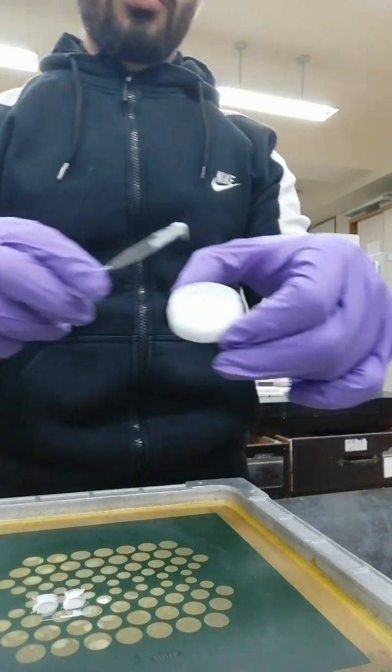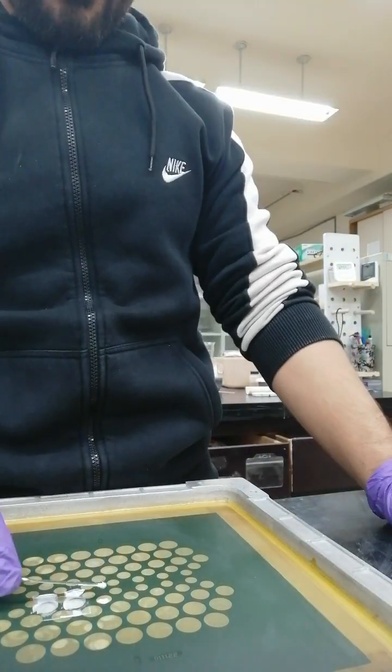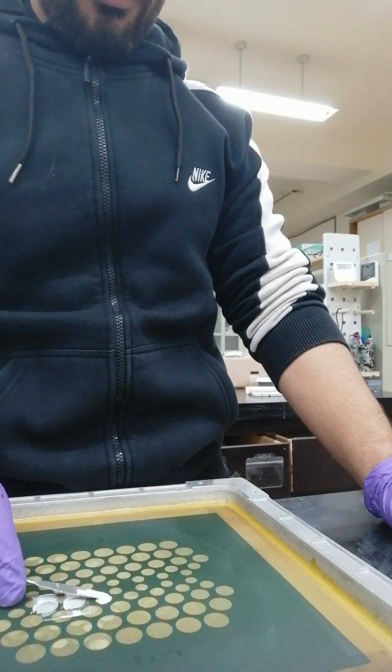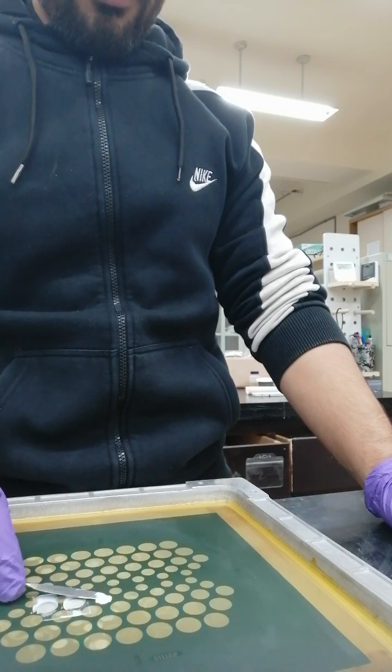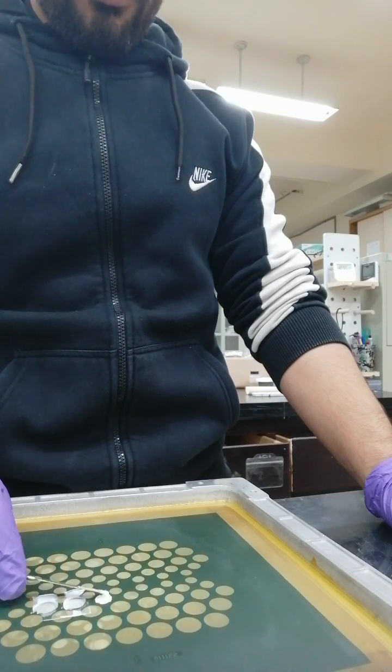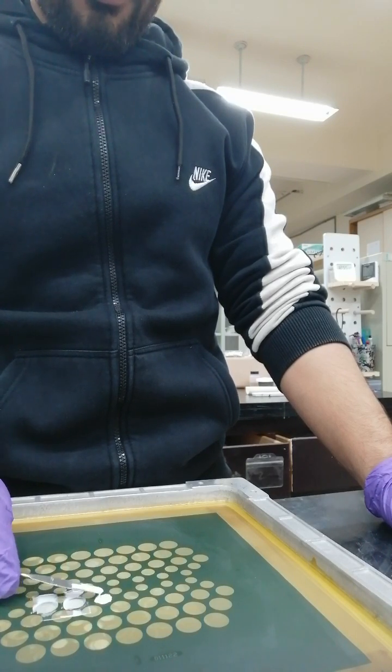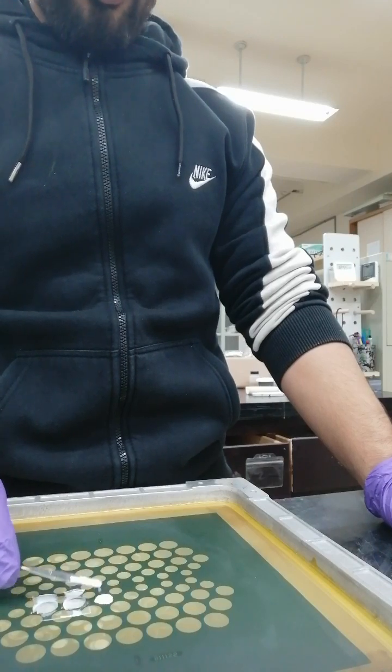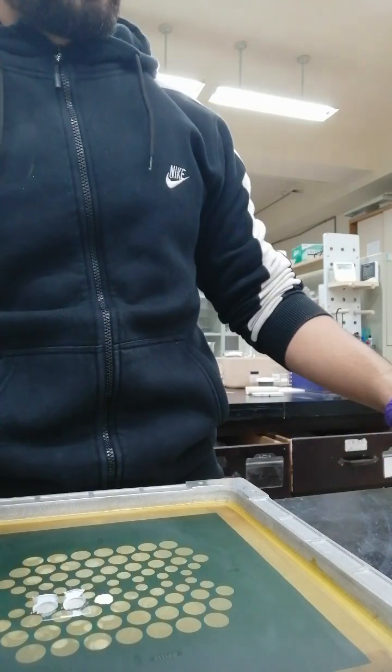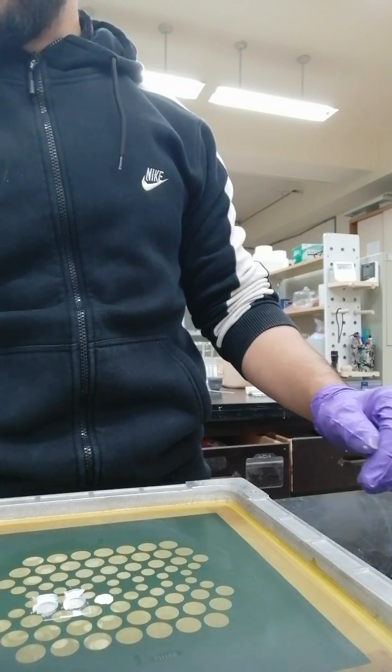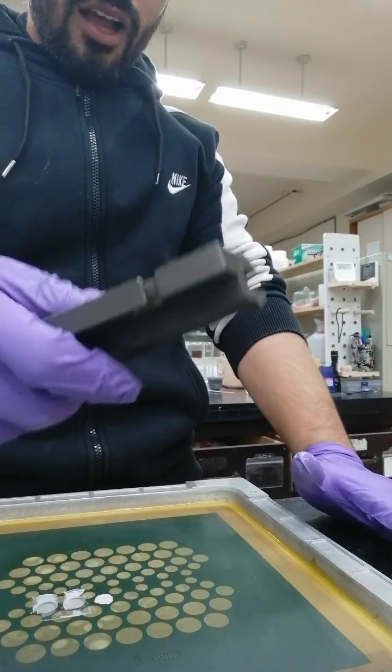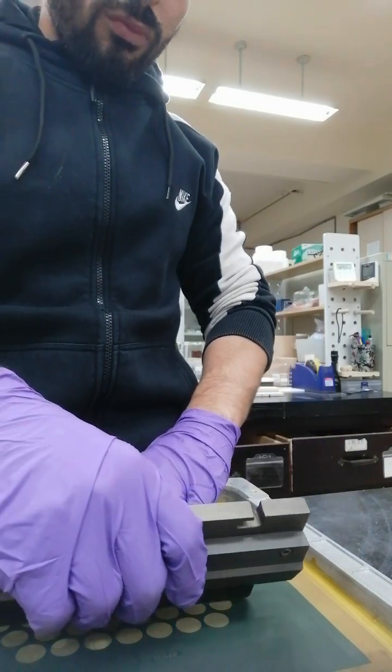This is our paste. Just make sure you cover all the screen printer's circles using the paste.